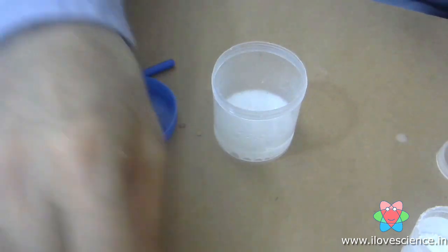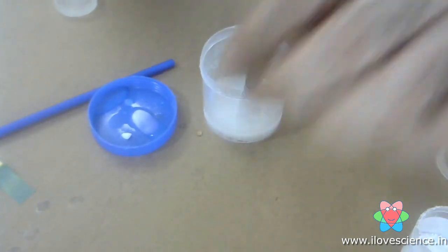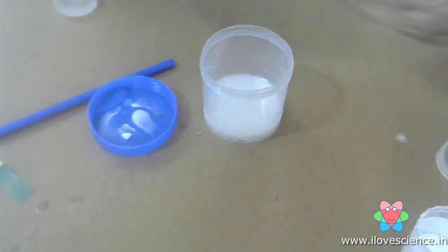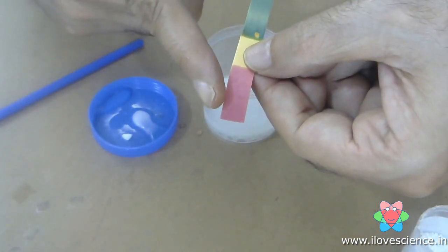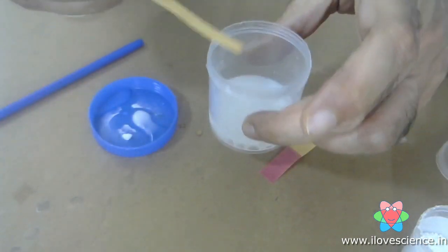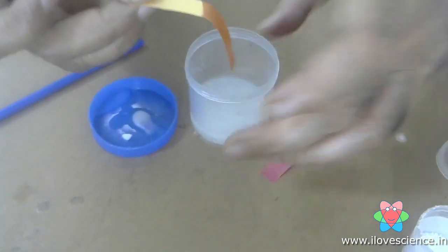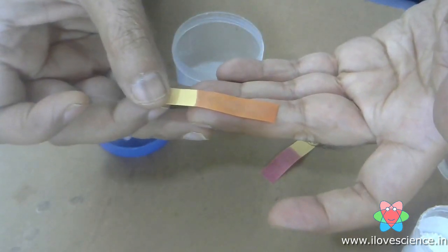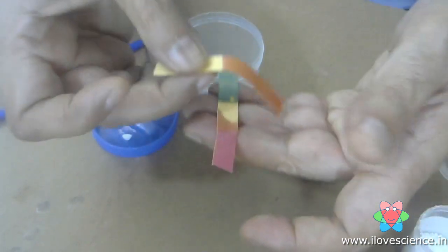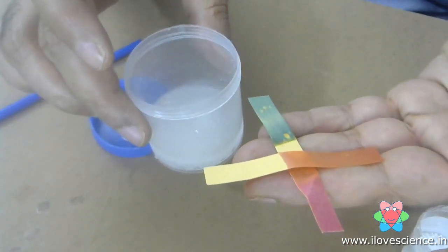Now we can do one more experiment. Now in the container we have the mixture of acid and base. So let's see if we put the pH paper in this, whether it will turn red or green. Alright, because we saw earlier that the acid turns it red and the base turns it green. Now let's see what happens if we put it in the solution after the reaction. Okay, so you see the color is a very dim red or almost no change. It's just like a wet paper. It's neither red nor green, which means that now this solution is neutral. It's neither a strong base nor a strong acid.